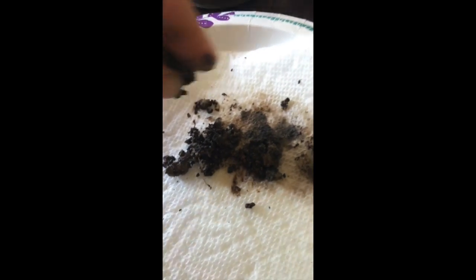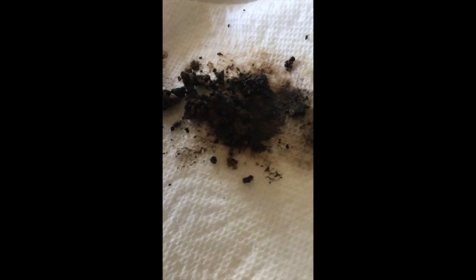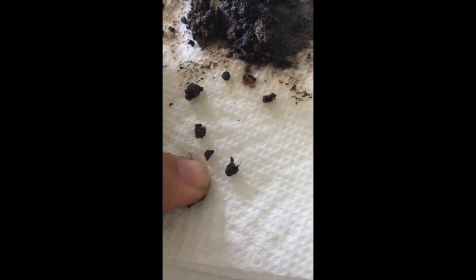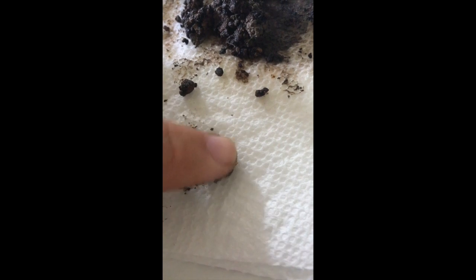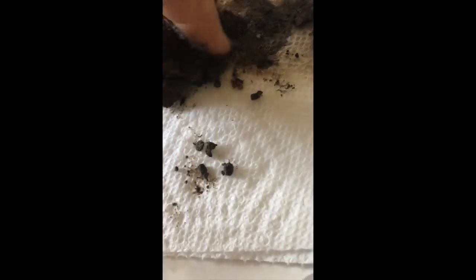So I'm doing the forest soil first. One thing I can definitely notice is it's extremely gritty. It does seem the aggregates are a lot more visible. You can see a couple of them right in there. A little bit more rocky than what I expected it to be. And it does tend to hold its shape a lot better, and it has a greater soil mass with less slumping. It's easier to stick together and able to hold its form a lot better than it was originally before it was wet.